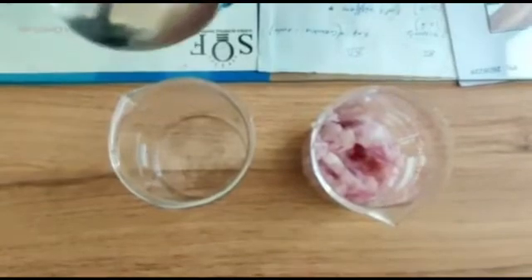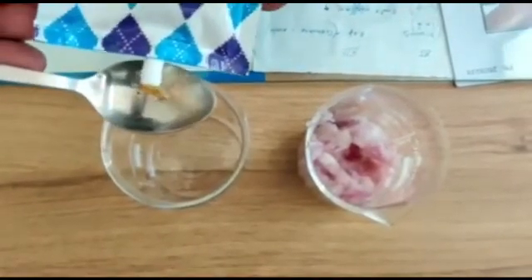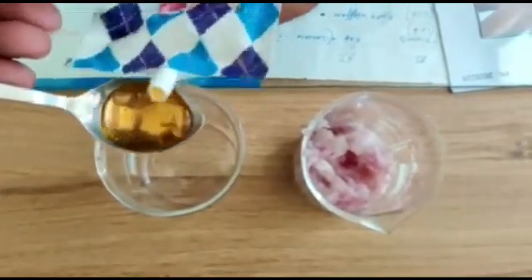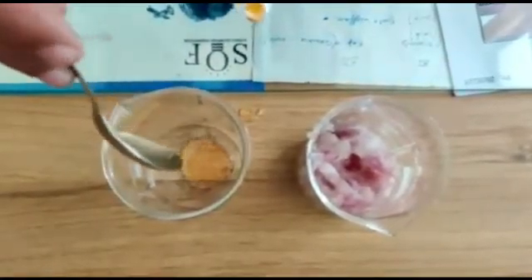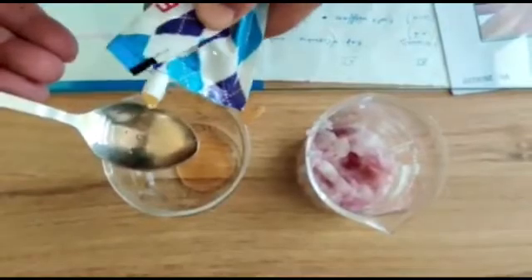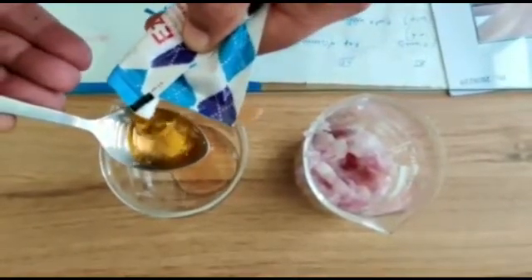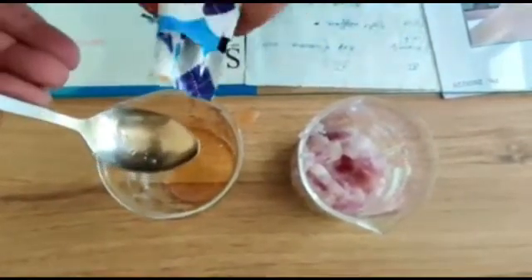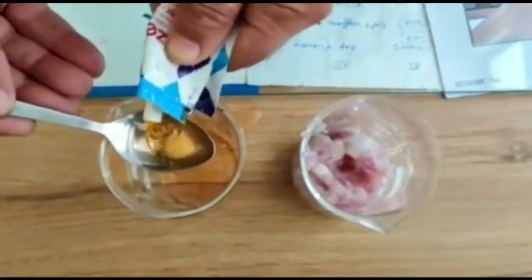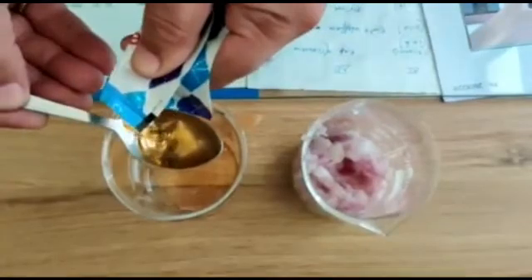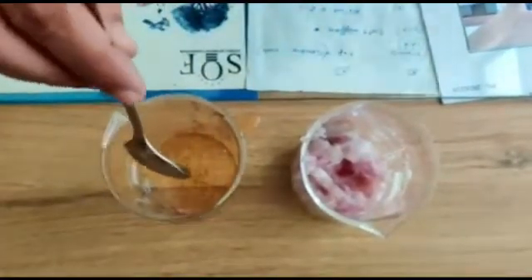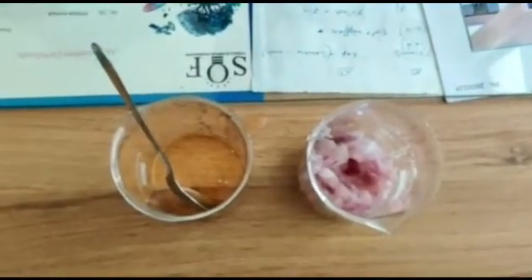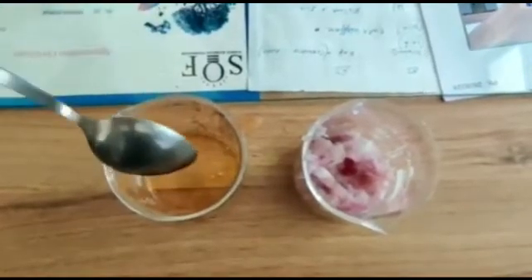We take three spoons of liquid detergent: one, two, three spoons of detergent in this. Then we have to add about four spatulas of sodium chloride.